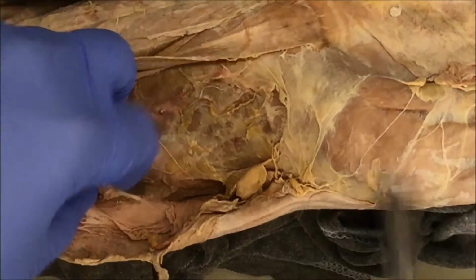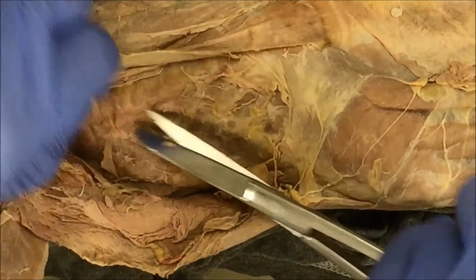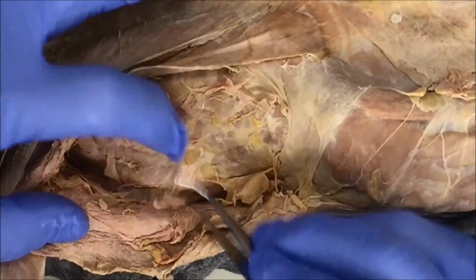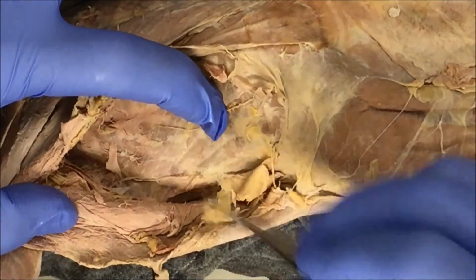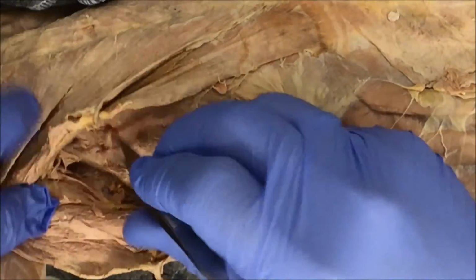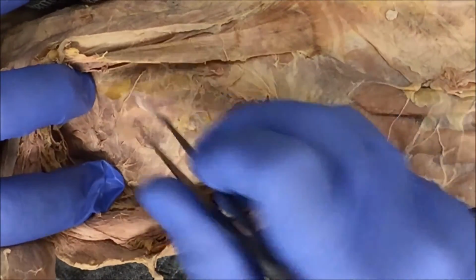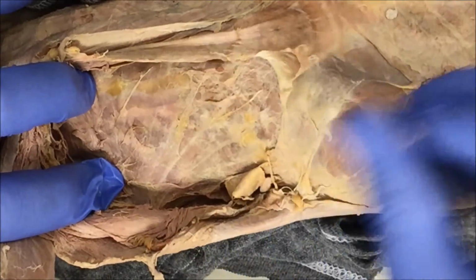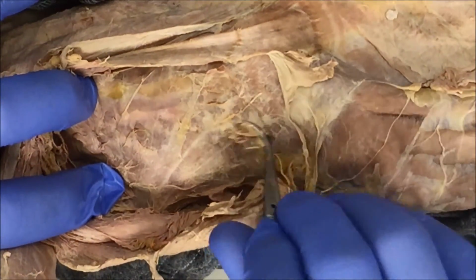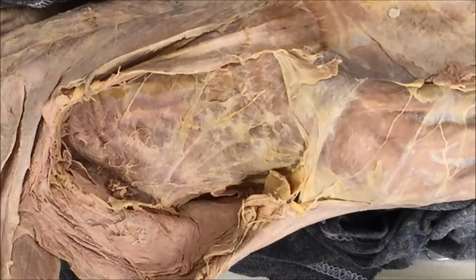So give me a moment. Let me remove all this stuff. This is all nerves and connective tissue. These are nerves that feed into the muscle to help during respiration, and we really don't need those. We're not studying those. All I'm doing is pulling off connective tissue so that you can actually see the muscle. Like I mentioned, the serratus ventralis is going to look like one of those old fans that radiate from a point, with pieces that extend out from that single point. As soon as I get to it, I'll show it to you.